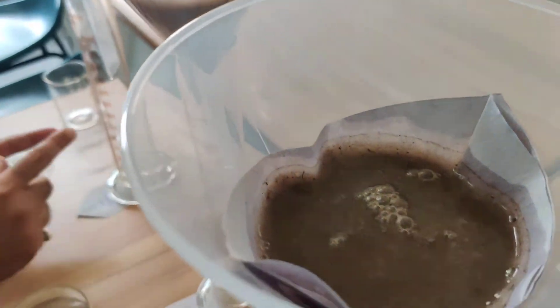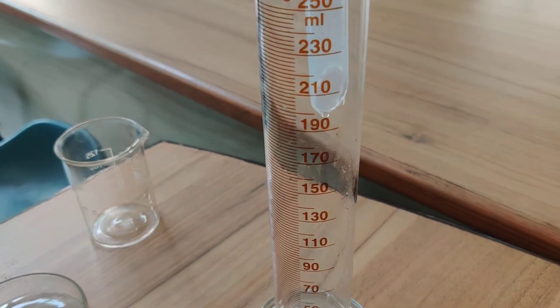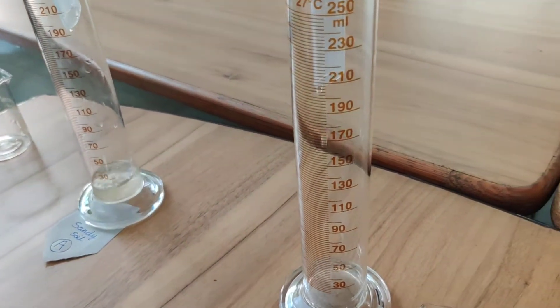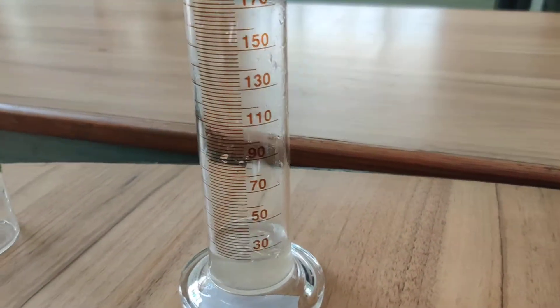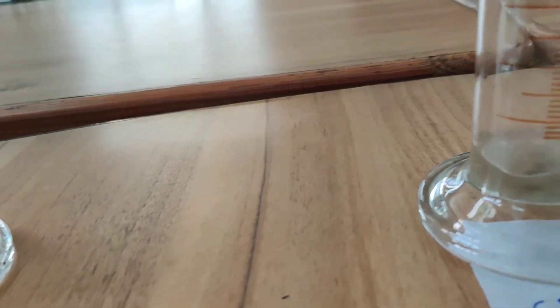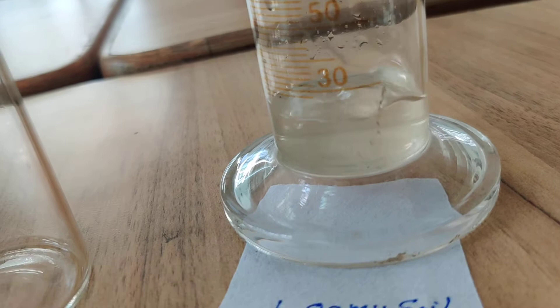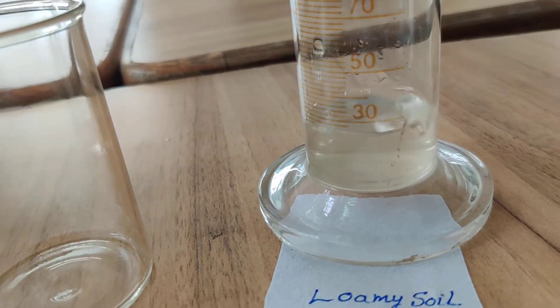Now you can see here that water is coming out through the funnel. After three minutes from the starting time we will take the first reading — how much water is collected in the measuring cylinder. I am showing you the movement of water through sandy soil, the movement of water through clay soil, and the movement of water through loamy soil. After three minutes we will take the first reading.